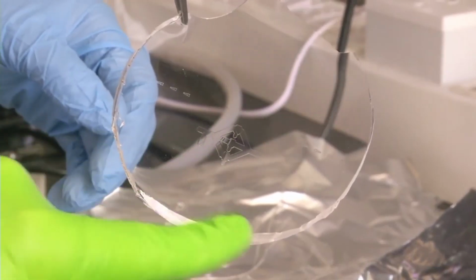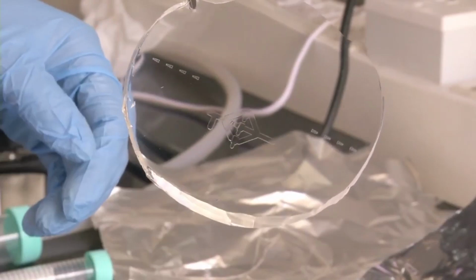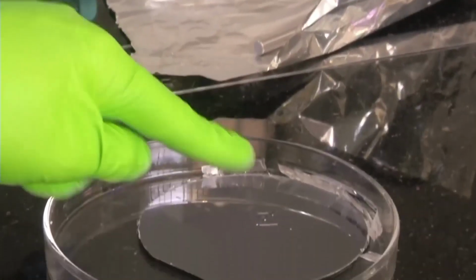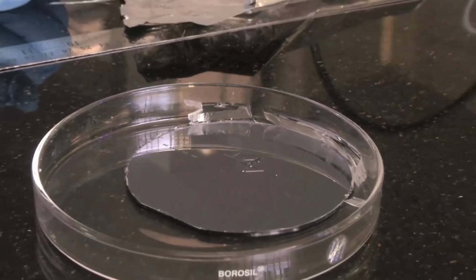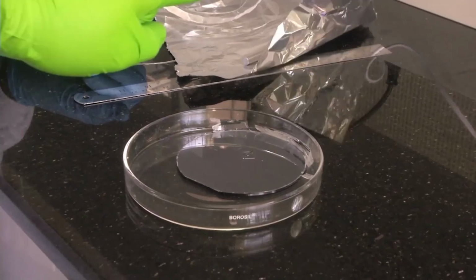The pattern has very nicely got formed on the PDMS membrane, and it will be a channel. Here it will be a ridge on the wafer, and on the membrane it is a channel. This is how we make PDMS based microfluidic channels. The next task is to cut out the device with our required dimensions that we can do with a knife, and then we can cut it out with whatever dimension we need.